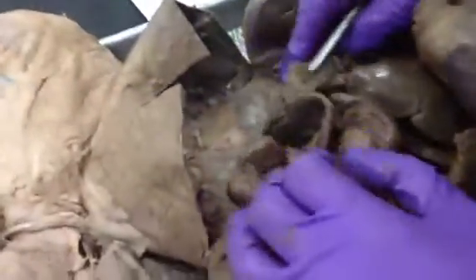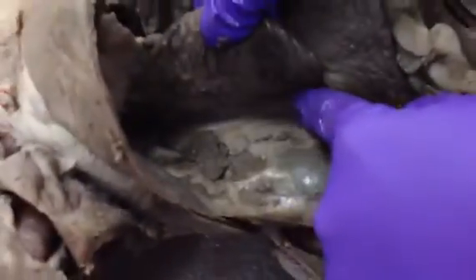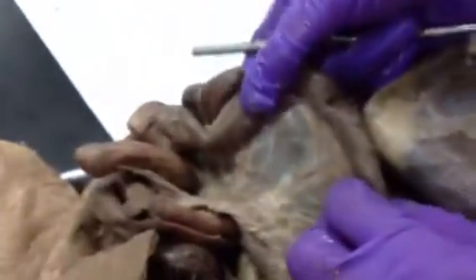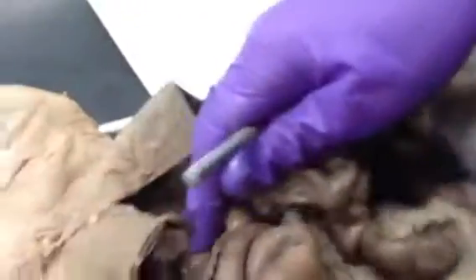And the mesocolon is what suspends the large intestine. So, like if you look over here, the mesentery that suspends the large intestine is the mesocolon. The mesentery with the word "the" in front of it suspends the small intestine. And that is it.